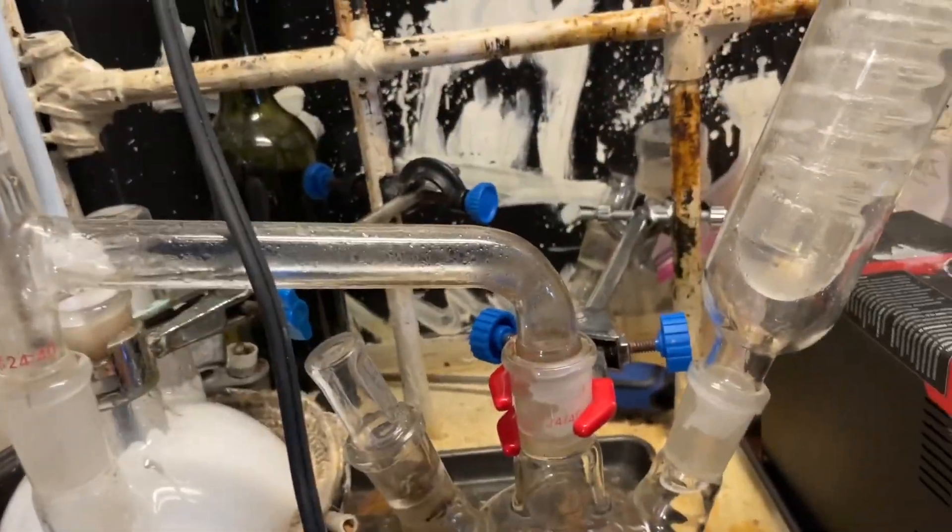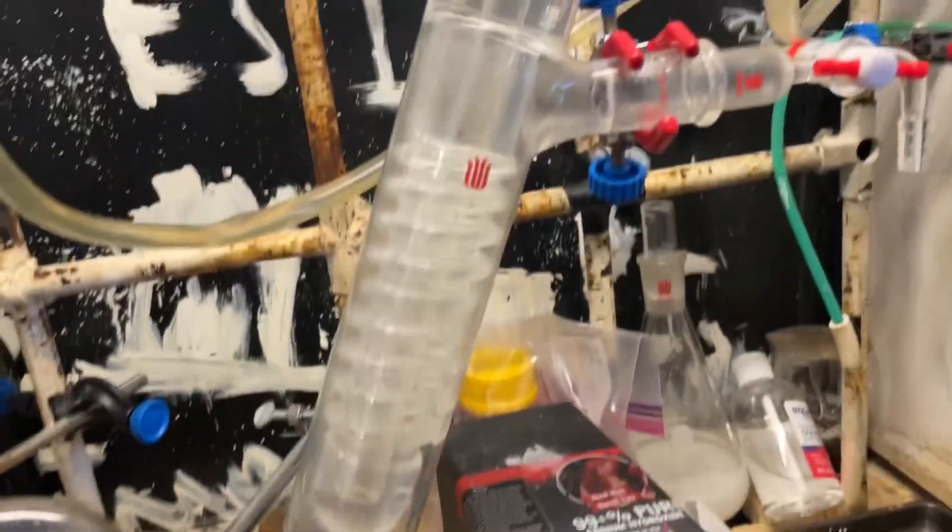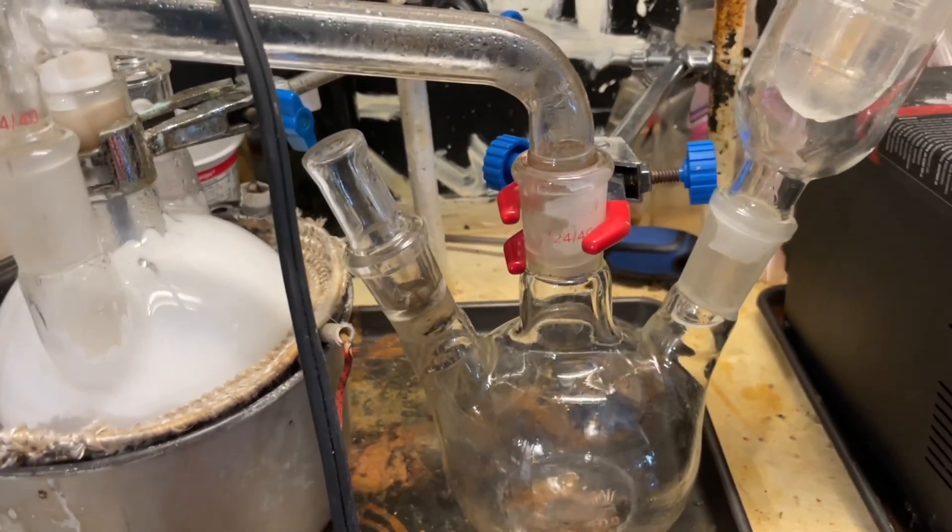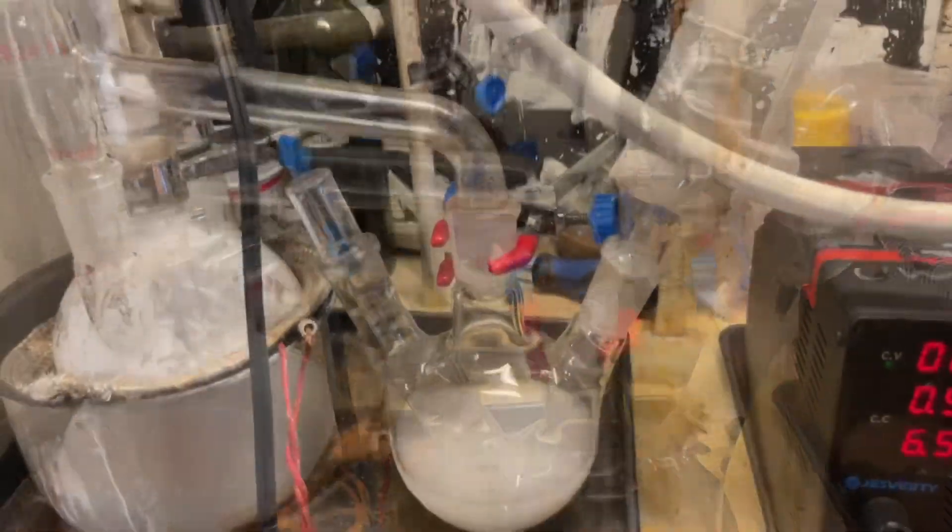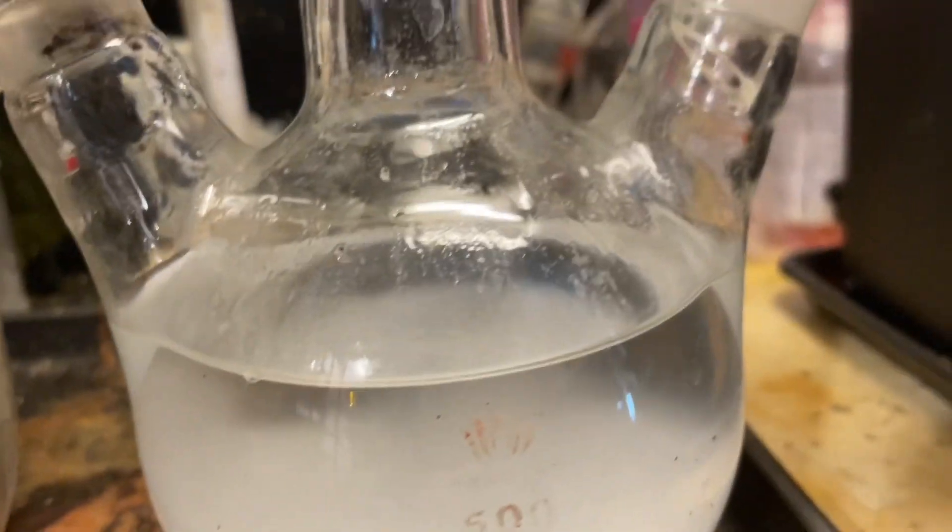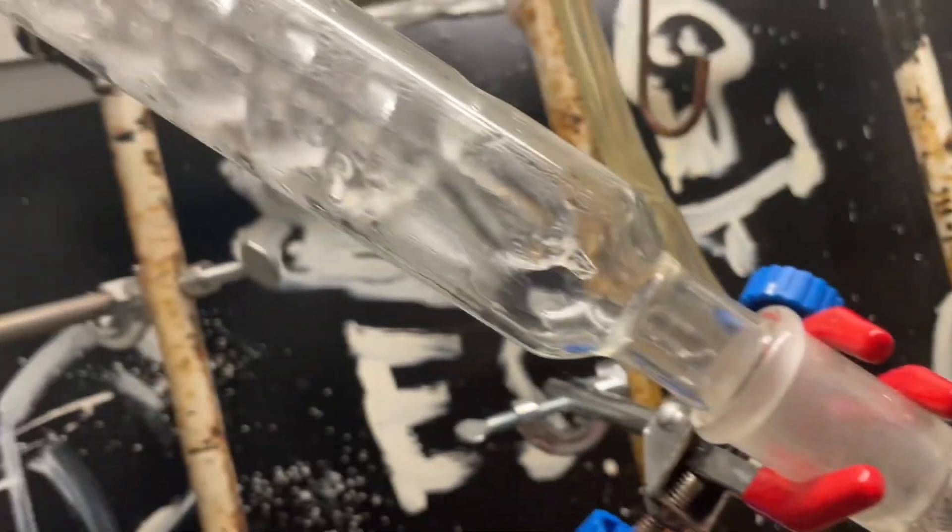Okay, I've actually decided to remove the vacuum for now because you can see the water is getting past the condenser. So, I'm just gonna let all the water distill over first. Then I'll swap out the receiver to collect our benzyl alcohol under vacuum. Then it's worth doing under vacuum. Now, me being the impatient person I am, decided to do under vacuum anyways with a long condenser. Because it's a bit faster. Still took like an hour though. But here's our water azeotrope. It's still just condensing away, but very rapidly. So, that's why I did it under vacuum.